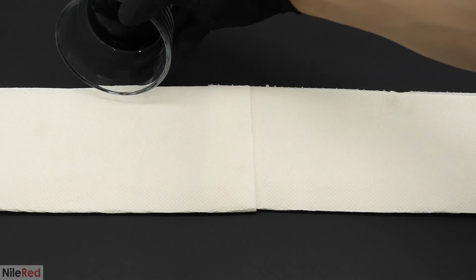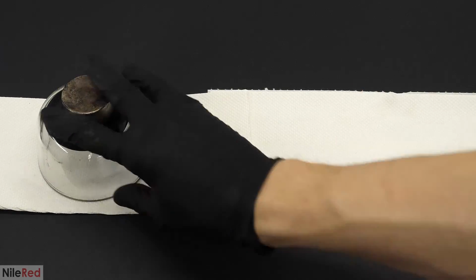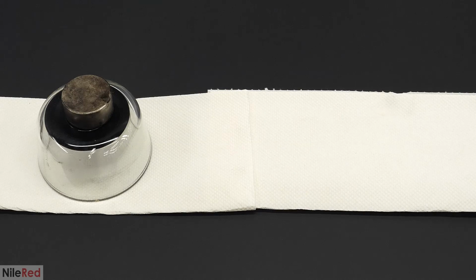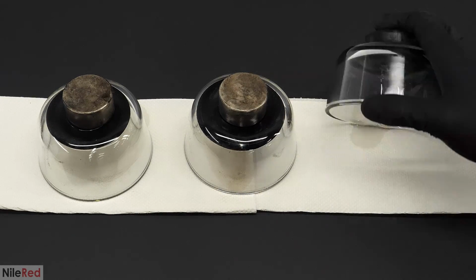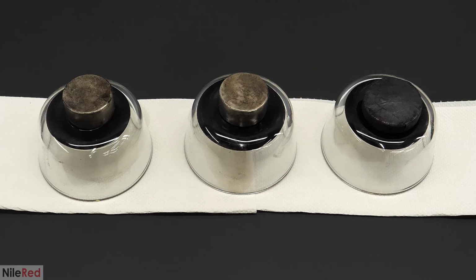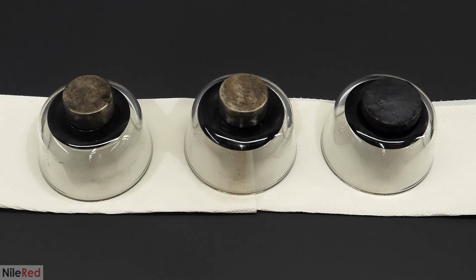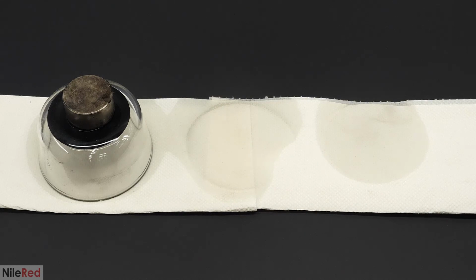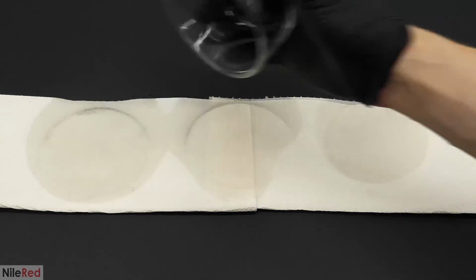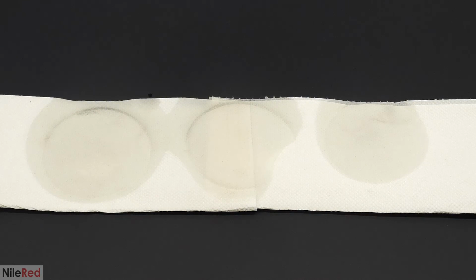With the magnet still stuck to it, I put the bowl upside down to drain away some of the alcohol. I then did the exact same washing process on the other 2 batches, and I put them here when I was done. About 10 minutes later, it looked like most of the alcohol had drained out of them, but there still was a decent amount in there.